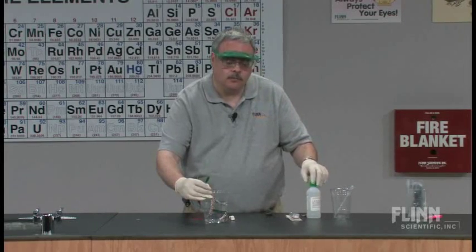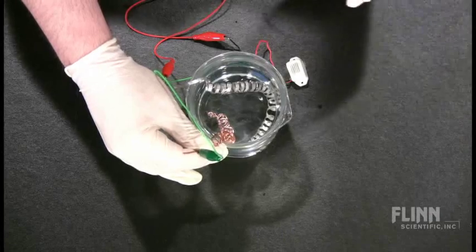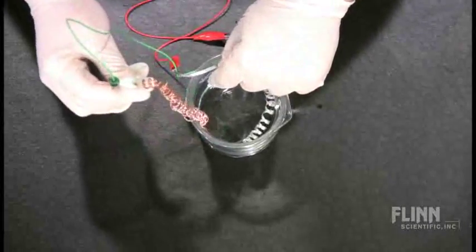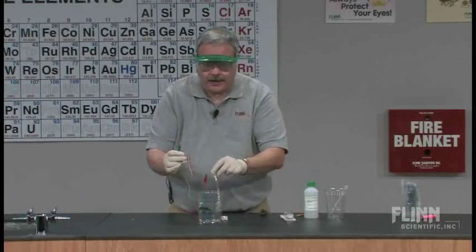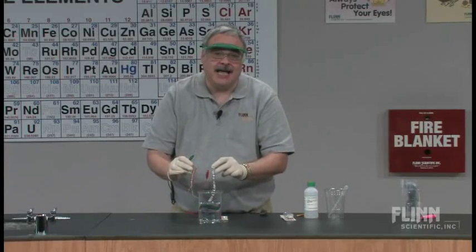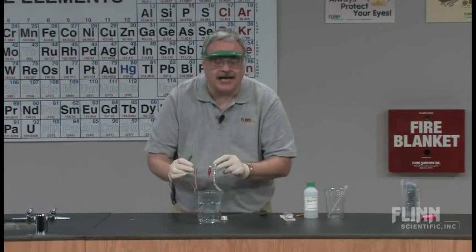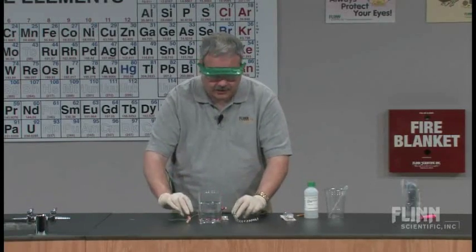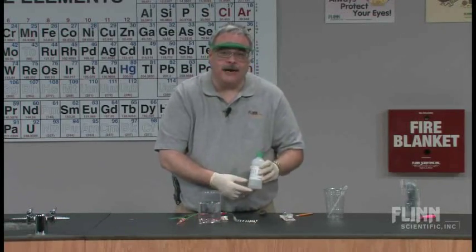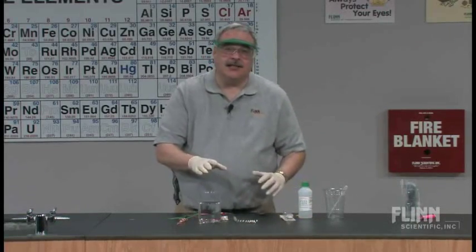What does that mean? With the buzzing, those two pieces of wire aren't touching. But what's happened is, in this circuit, we have finally completed a circuit. We had the two pieces of metal close by, but we needed something to bridge the gap — some kind of connection. We needed the ions in solution to do that. The hydrochloric acid breaks up into hydrogen ions and chloride ions, and so you've got the ions in there.